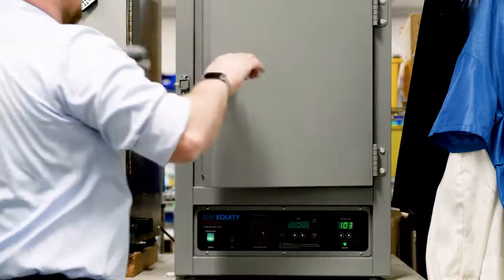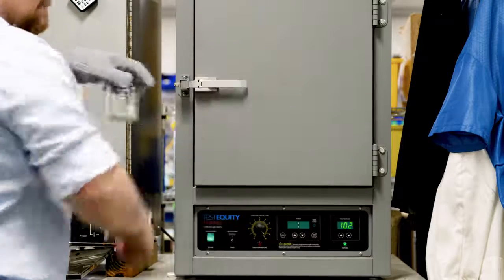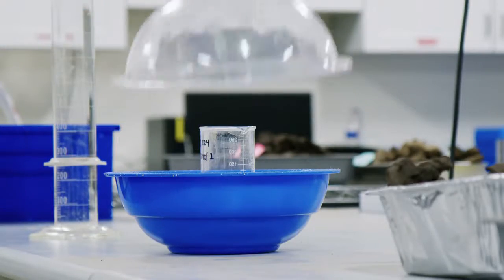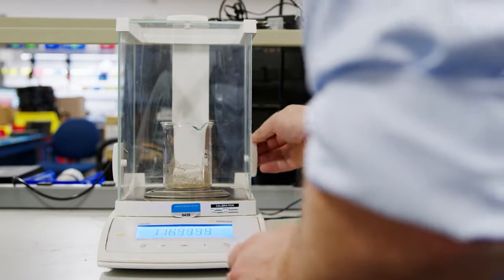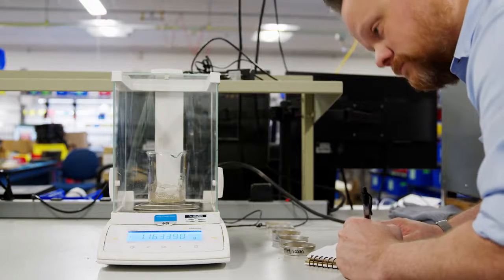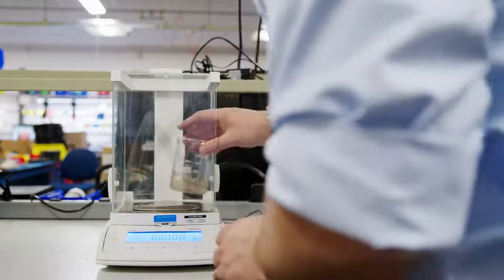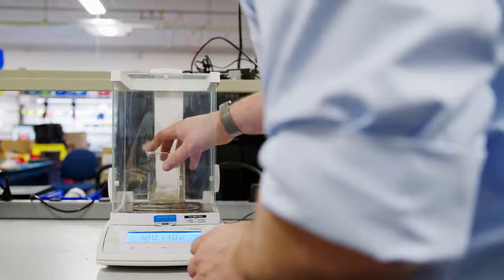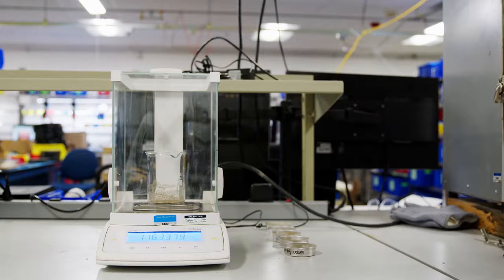After the drained subsample drying is complete, remove the beaker with the dry mass from the oven and place it in a desiccator to cool for a few minutes. Then place it on a balance and determine the weight within an accuracy of 1/1000th of a gram. Calculate and document the dry sample weight. Please be extremely cautious and precise when weighing this sample. Errors in weighing will directly lead to errors in the determined clay fraction of the soils. For more guidance, see the user manual.